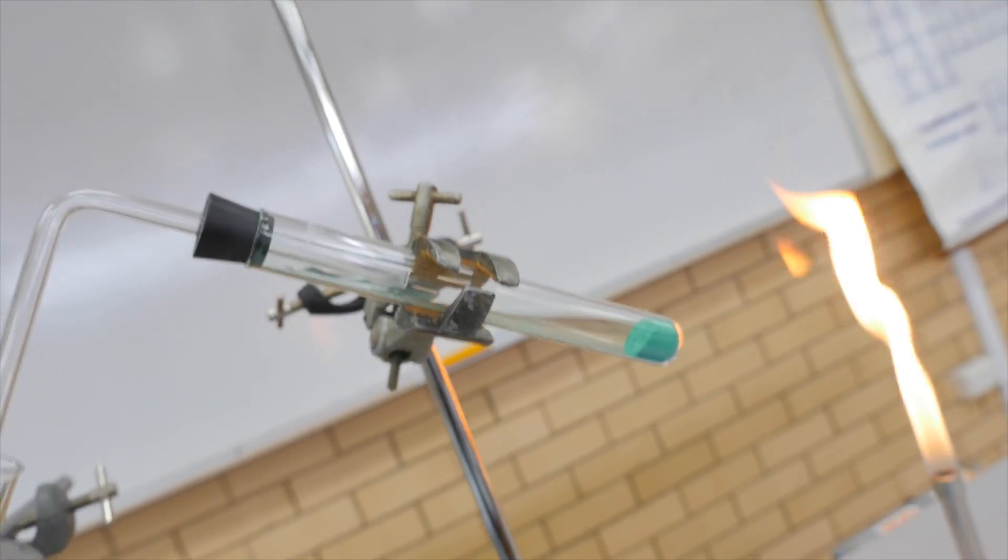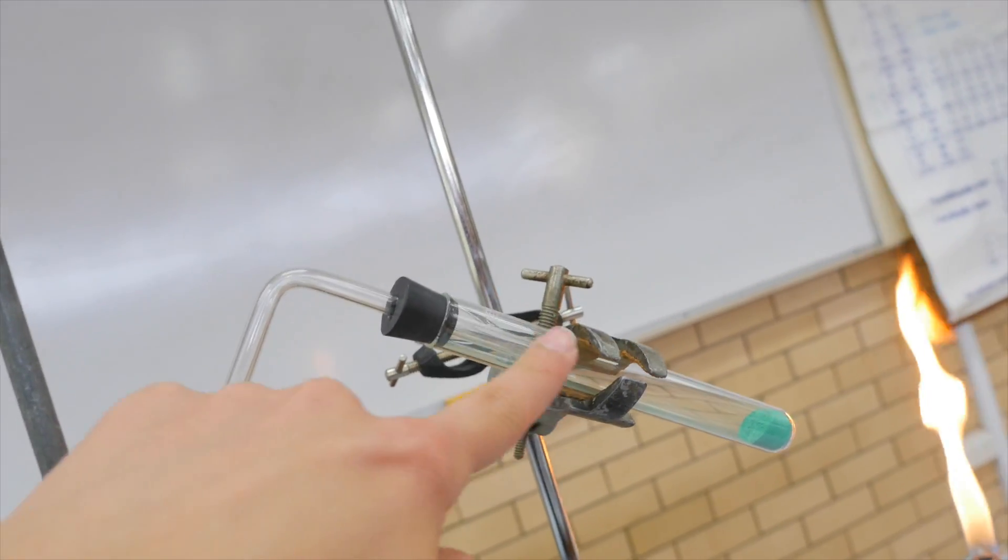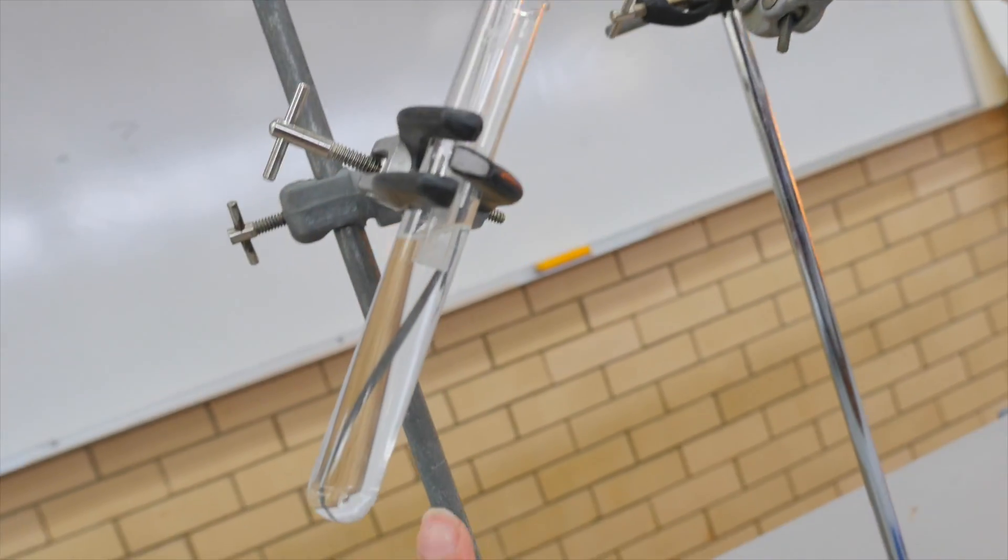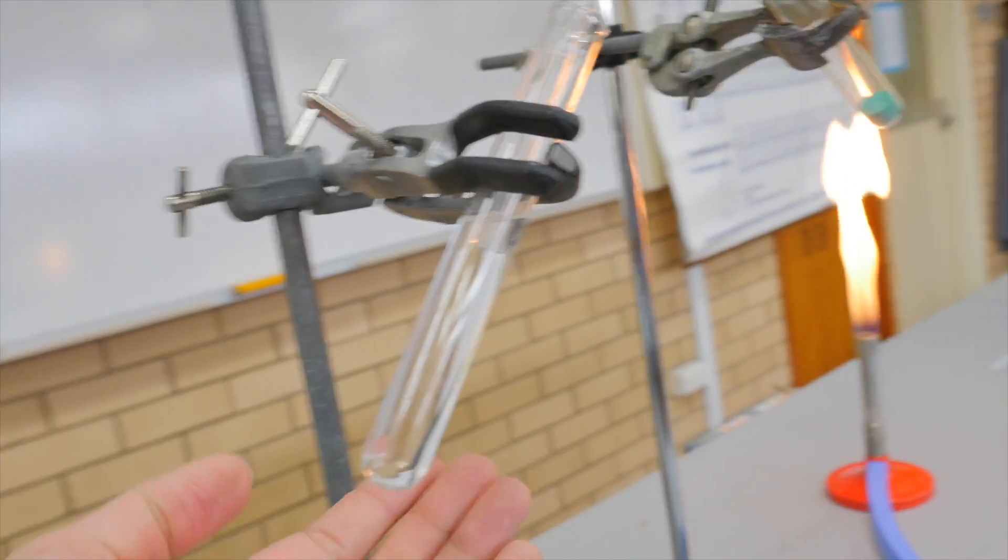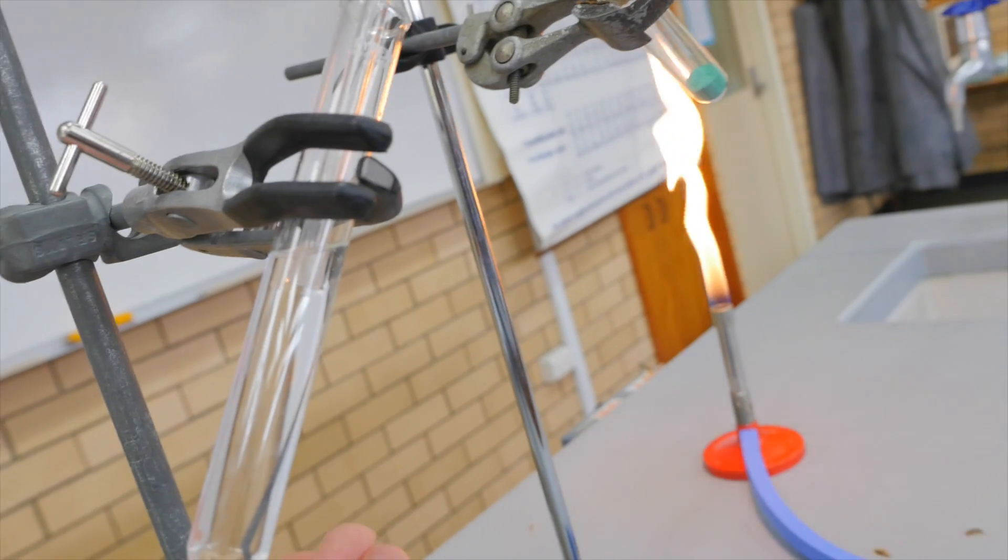So, here we've got in a sealed container. Glass tube, there's a rubber bung, a tube and that goes into some water here. So, I can see if there's bubbles being produced and that might tell me it might be carbon dioxide, but that could be any gas.